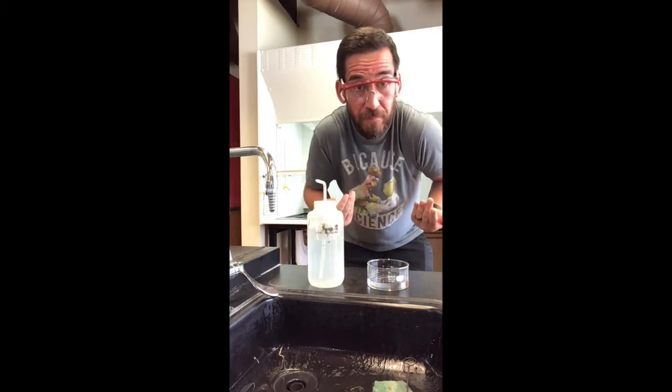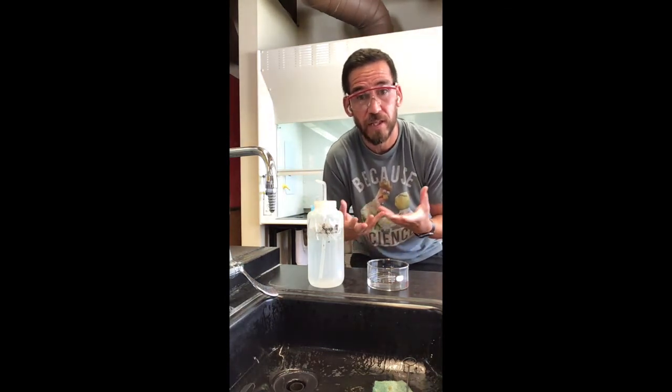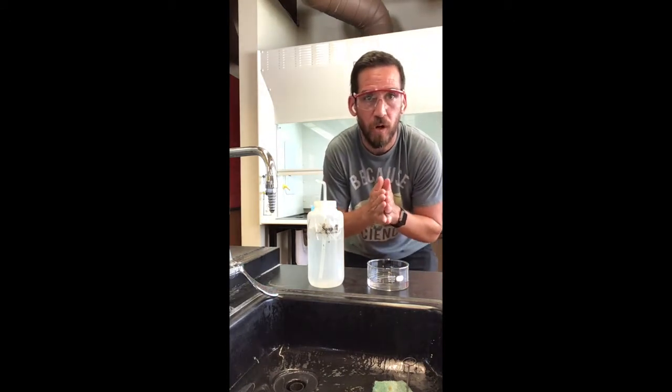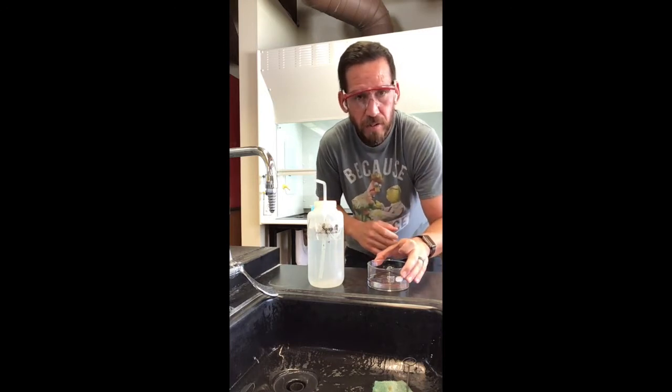Okay, so it's really important to read through your laboratory procedure before you come in here, because you want to get an idea as to what you're doing before you actually do it, okay? For example, we are doing an extraction today, and then after those extractions, what we're doing is we're boiling down the methylene chloride that we've obtained. And how are we doing that? Well, we're doing it in a hot water bath, right? Well, hot water takes a while to heat up, and so you want to set something up before you actually need it, if possible. For example, a hot water bath.